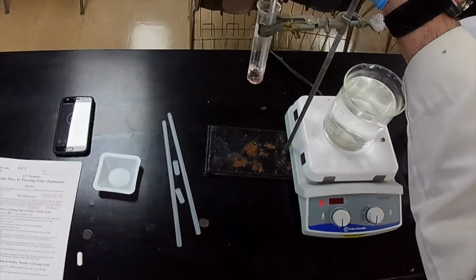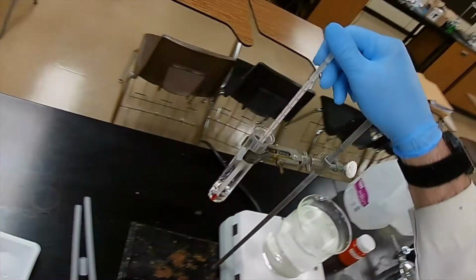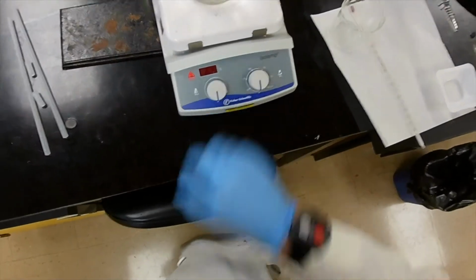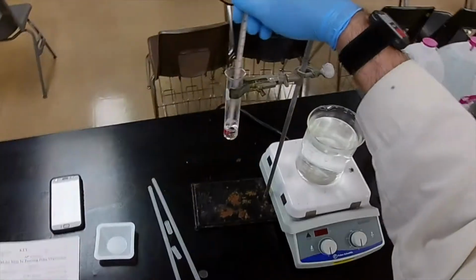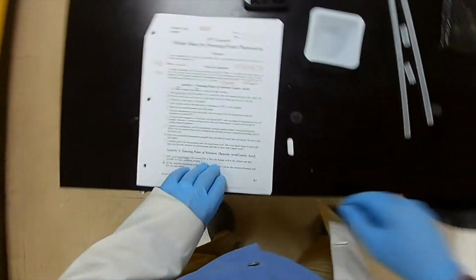Now we're going to do the same thing. We're going to watch it till it gets to 60 degrees and then begin our measurements. Okay, it's gradually cooling down. And we don't need the hot water anymore, so I've turned that off. And while I'm waiting for safety, I'm going to unplug it. Okay, temperature. It's 83 on its way down. Just have to wait. Patiently wait for this part.